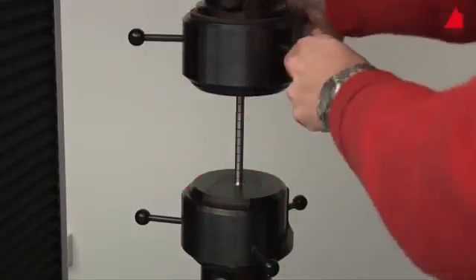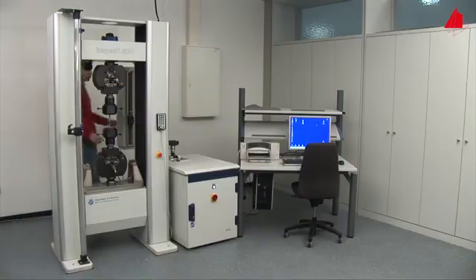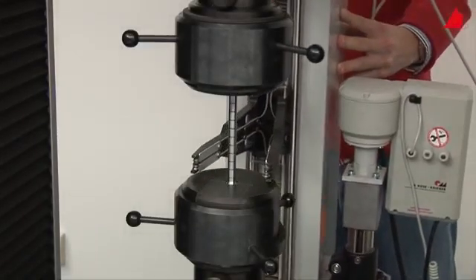In the next step, he swings the extensometer into its working position and checks that everything is correctly prepared.